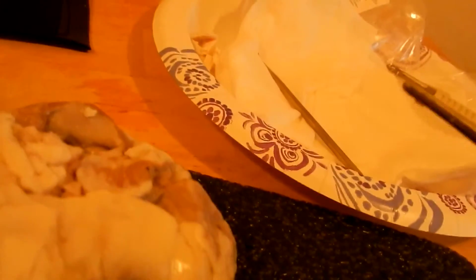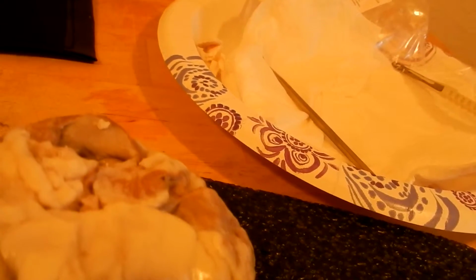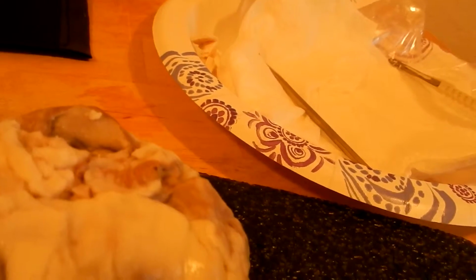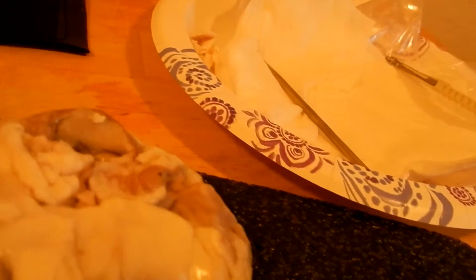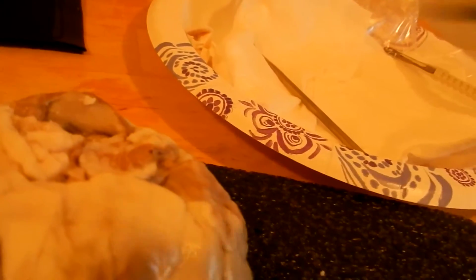That's important because the vena cava empties the deoxygenated blood into the right atrium, and the pulmonary veins are responsible for emptying the oxygenated blood into the left atrium. Alrighty, so you saw the pulmonaries before, and the left and the right atrium.